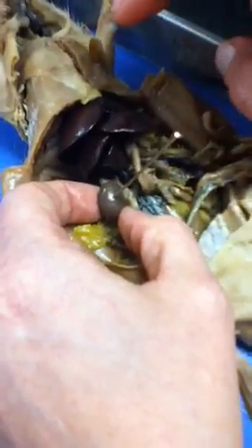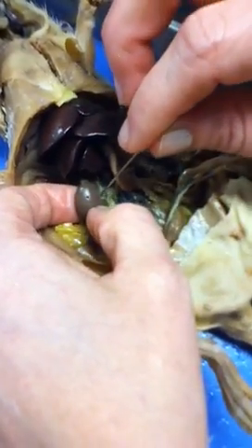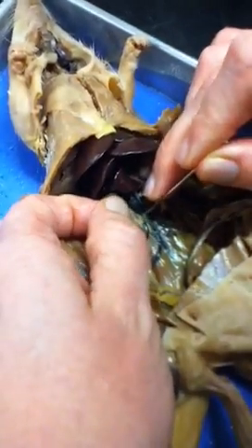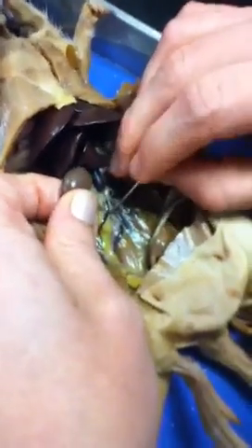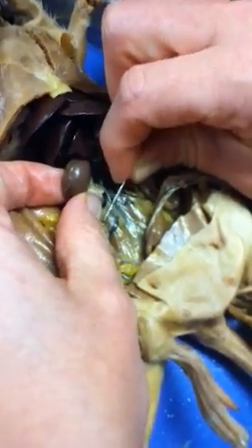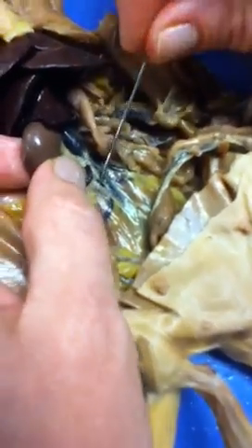You have two parts to your kidney. You have your left kidney cortex, and you have your medulla. Okay. Attaching your kidney to the urinary bladder is this small tube that looks like this, and that is called your ureter. Would you pin that? I could. I would pin it exactly like I'm pinning it now. That's your ureter. Your ureter leads into your bladder, which is actually non-existent.